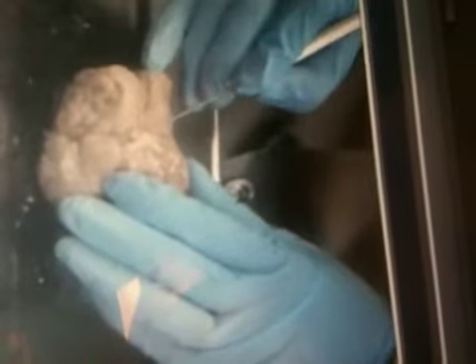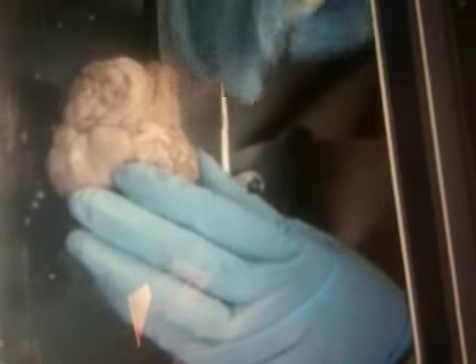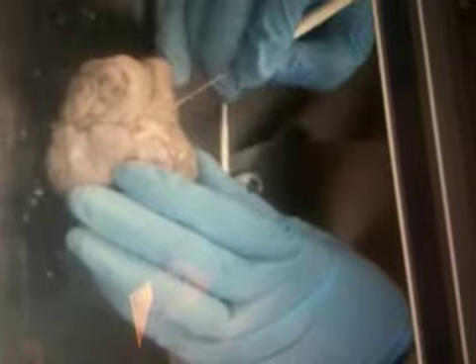As we move posterior, we see this X. This is called the optic chiasm or optic chiasma. Both are correct. But if you can imagine, these are the optic nerves that then move forward to each of the eyeballs. But what they've done is they have cut these. So what we're looking at is the optic nerve from the sheep's right eye moving towards the occipital lobe on the opposite side, and the sheep's left eye crossing over to the right side of the brain. And that crossing right there is called the optic chiasm. I'll put the probe in it so that you can see it.